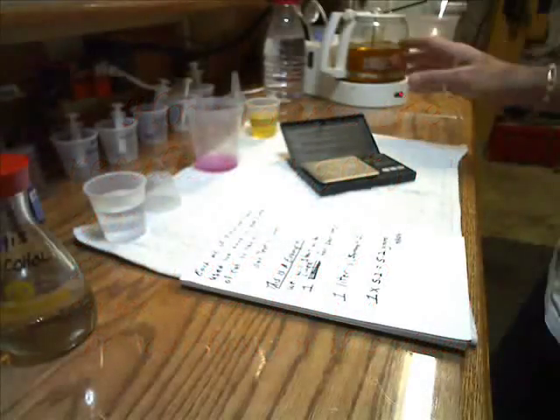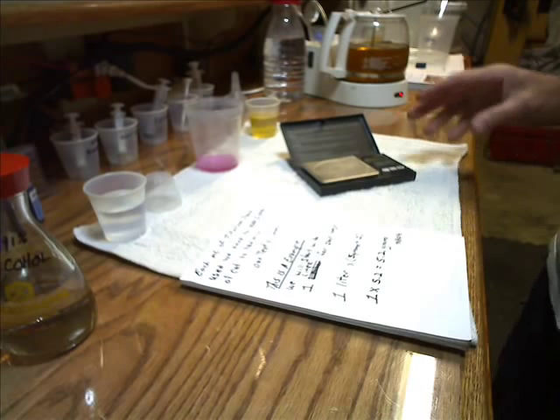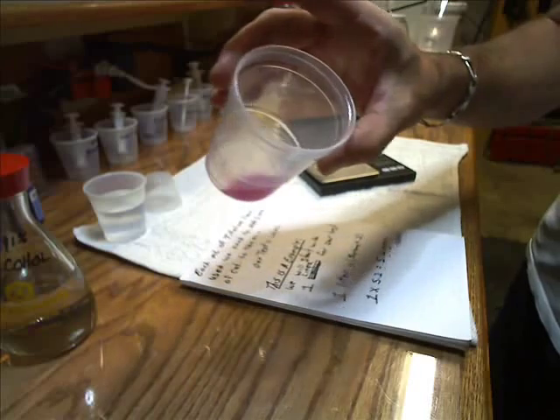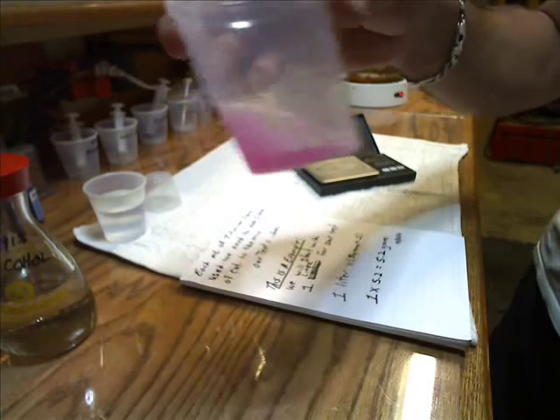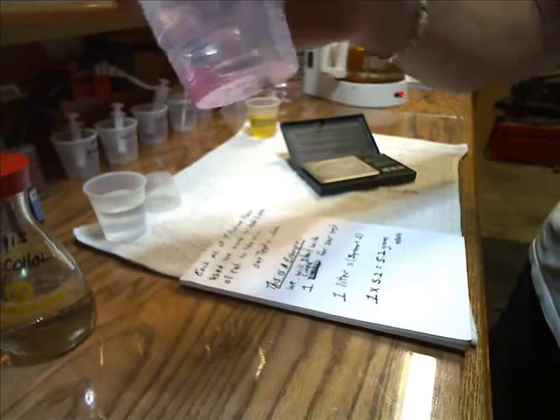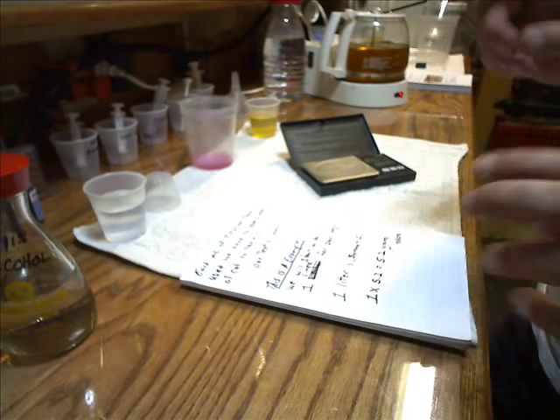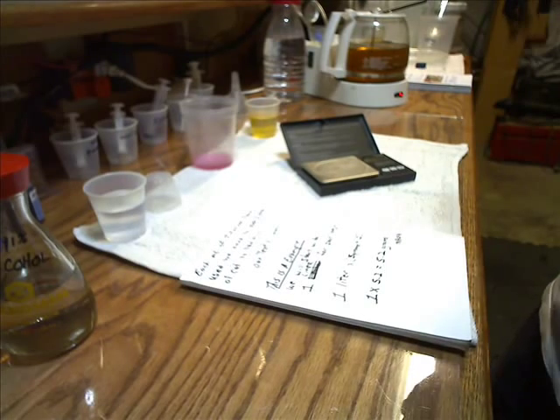All right, everybody, it's time to do our calculations on the results we came up with. Here it is — this is what happened after we did our titration test. This has been sitting here for a few minutes and it's still pink, so we know that we found our pH level. That was 0.2 milliliters.